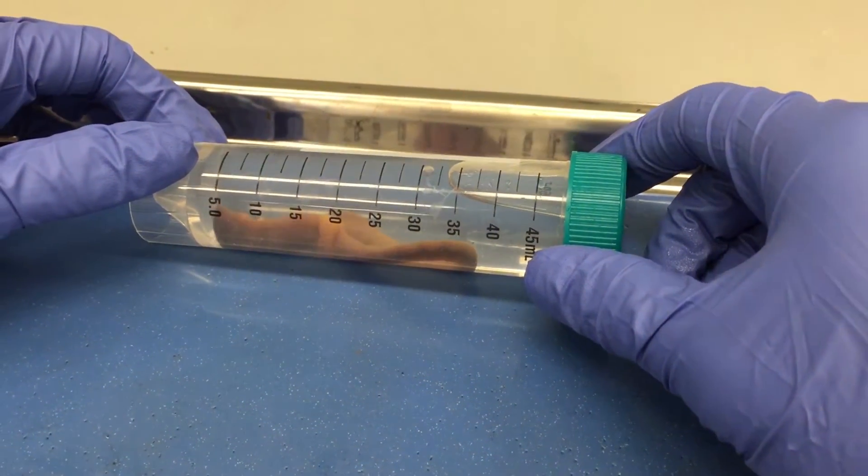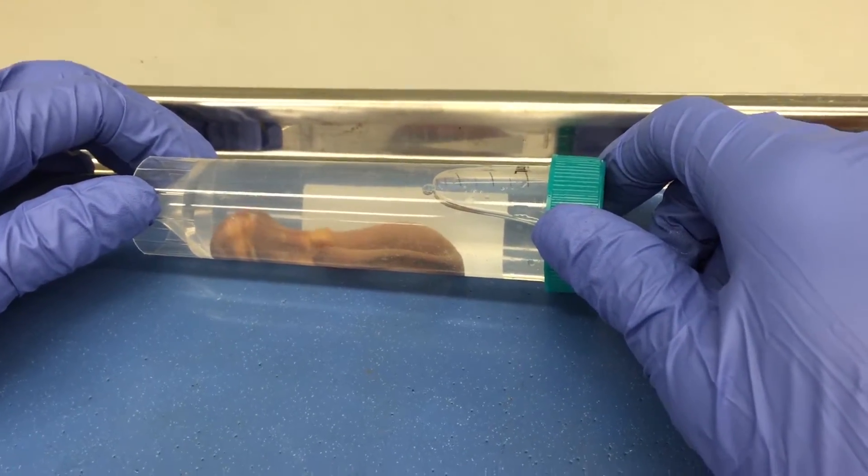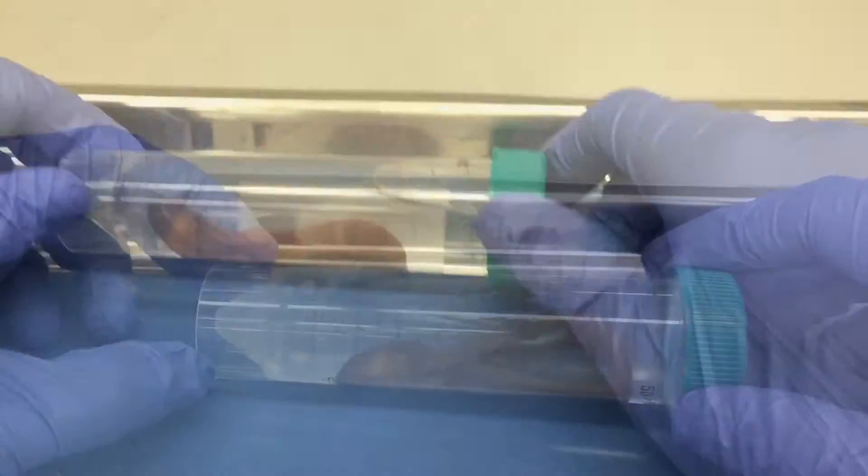Do not leave the worm in the ethanol for too long or you will over anesthetize it and you won't get any good data for your contractions.